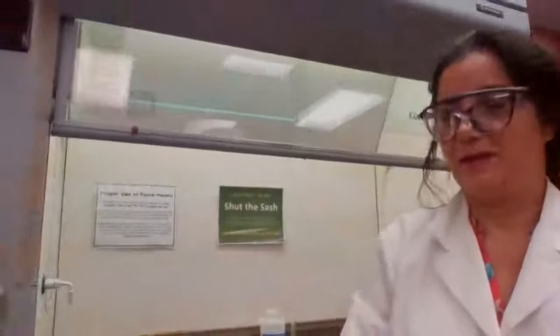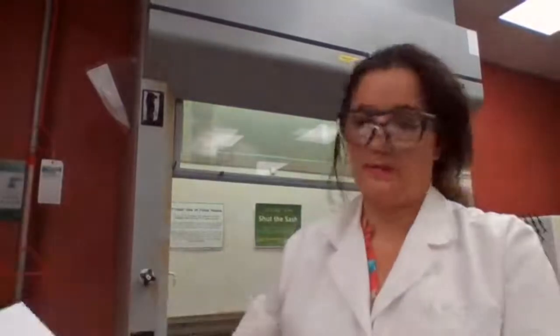Just taking a break, and looking into the procedure. It's going to be a while because it's still too dark. I'm going to give it some time and go back and mix it again.